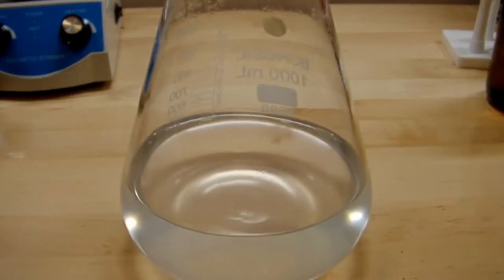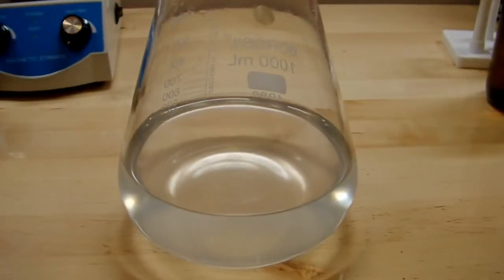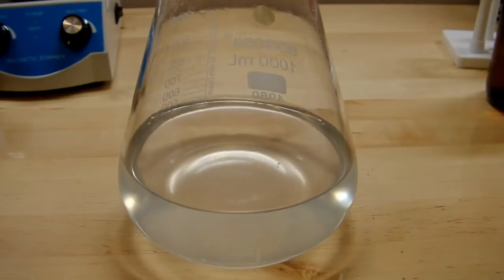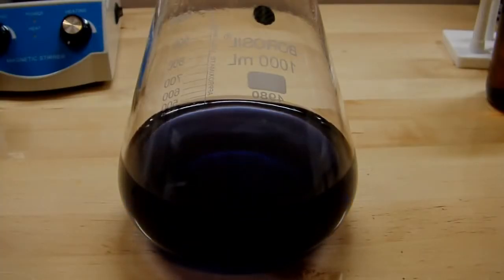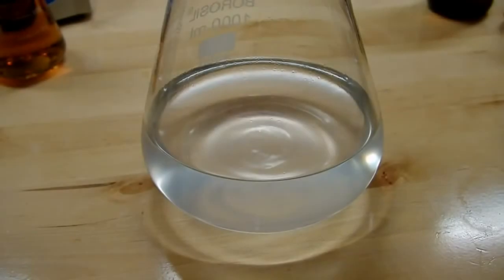because once it clears up, if you leave it alone, it tends to go right back to blue. Now you can see the colors start to condense. So the iodine slowly complexes back with the starch to form that blue color again. So I just got to keep adding thiosulfate until it remains clear.